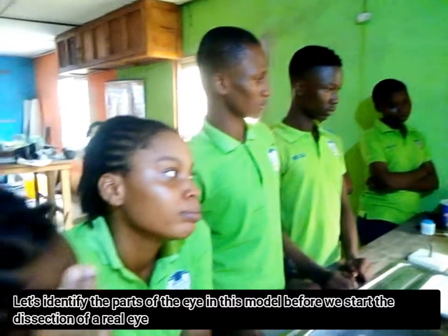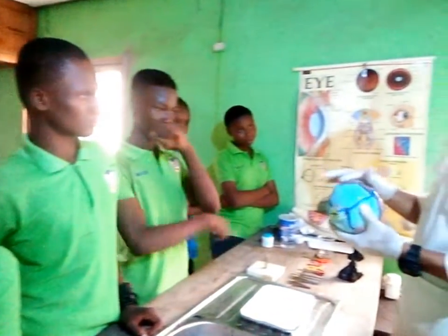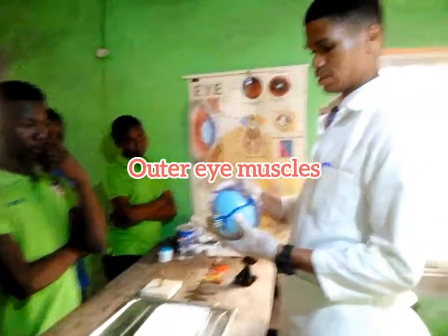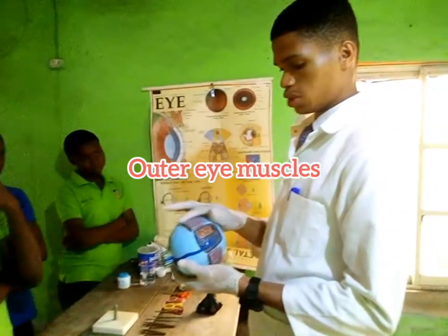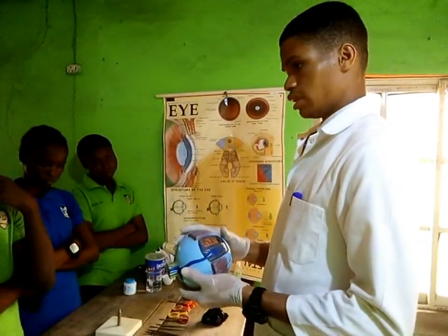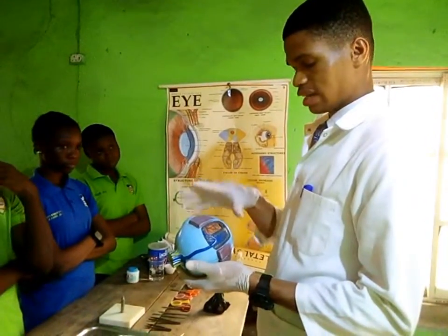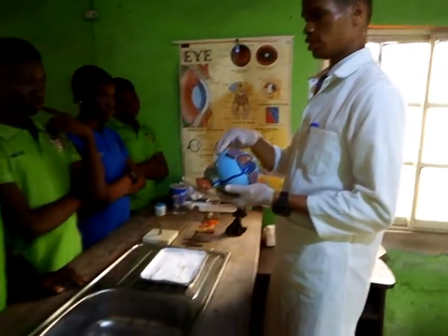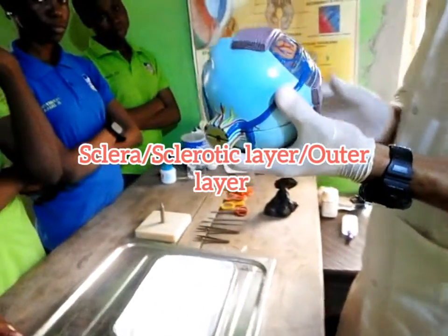Now here you see what we call the muscles. This is what your eye looks like. And then you see the muscles of the outer eye. Now, where the muscles are attached to is the part called the sclera, or sclerotic layer, which is this part you are seeing now.